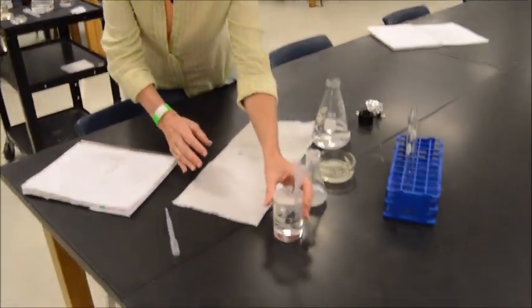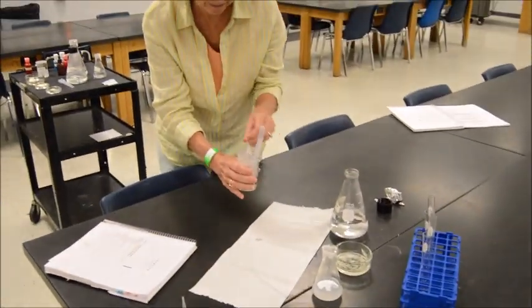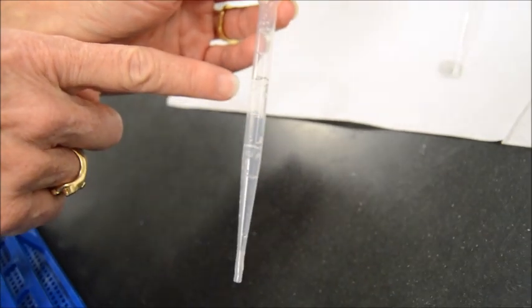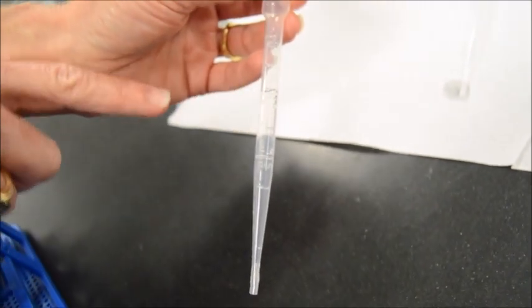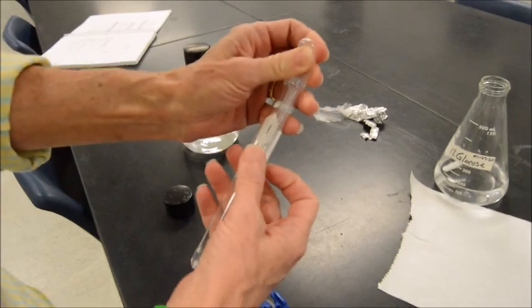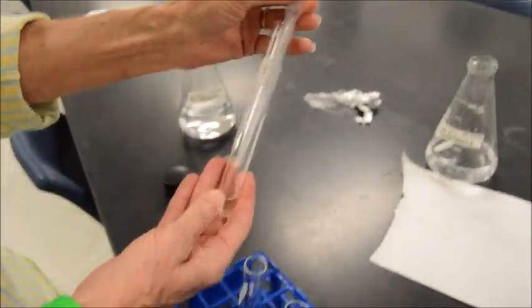All right, so we're going to set these test tubes up, and before we drop them in, we're going to come back. What we've got here is our pipette, a good old-fashioned disposable. Where's 2 milliliters at? Right here. You can see the line on it. That's going to be 2 milliliters going into our first test tube, identified as number 1, right there. So there's 2 milliliters in.